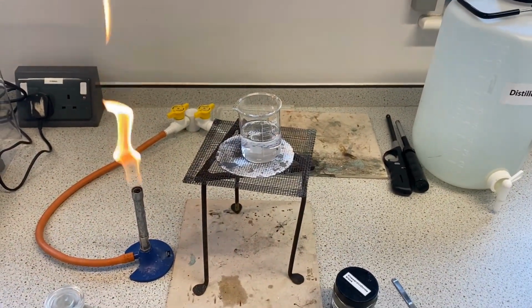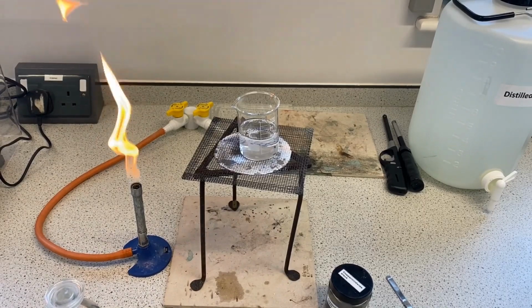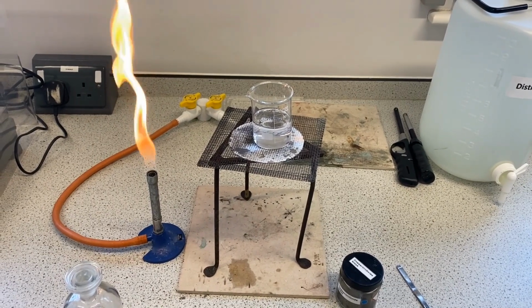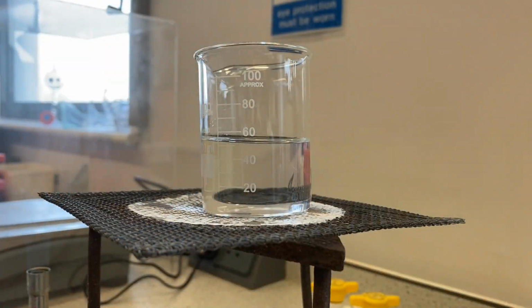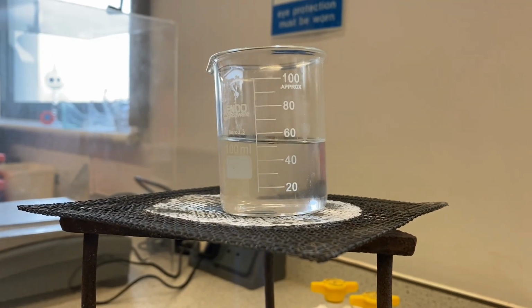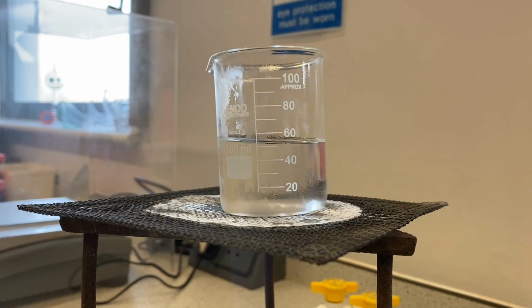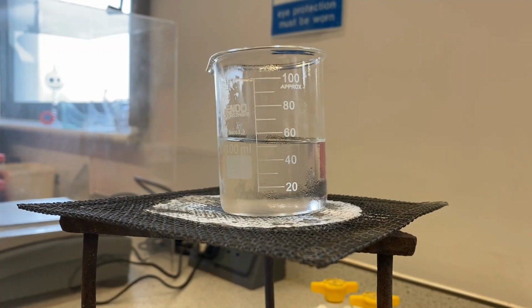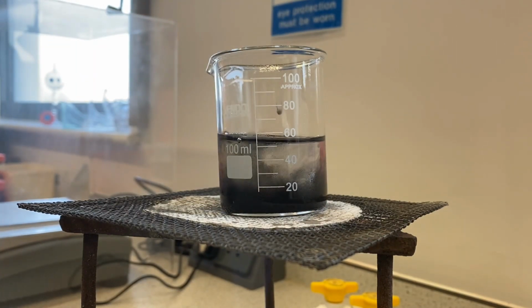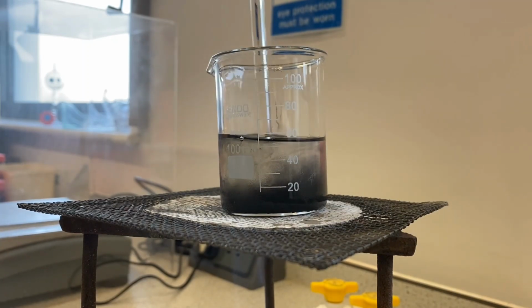To begin with, in the first step, let's do the reaction. Let's warm up the sulfuric acid and then slowly add the copper oxide so it dissolves and then it will be in excess. So here we go, about to just warm the sulfuric acid on a medium flame. There we go, so we'll get it warm and bubbling. And then we're slowly going to add the copper oxide. Begin with just 1 spatula full. And I'll use a stirring rod to gently stir it.